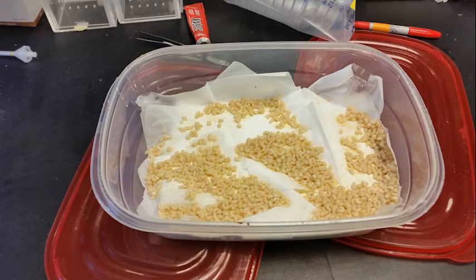Again, in nature, this would not happen unless there were no bee larvae or bee adults to take care of the larvae. But it's still an instinct that they have. And so we can use this to get the bees to all crawl out on their own. And we can get a huge number of bee larvae this way. And so you can see these bee larvae are all totally fine. They're alive. They've fallen out onto these special paper towels that we use.